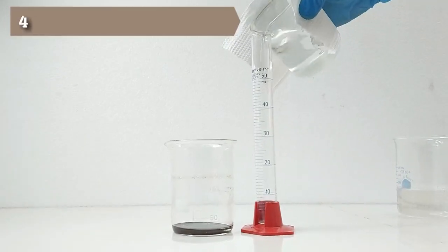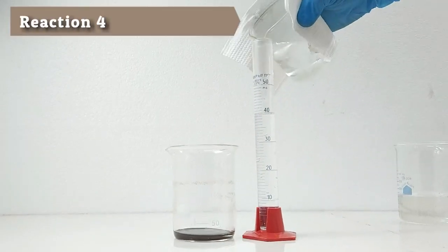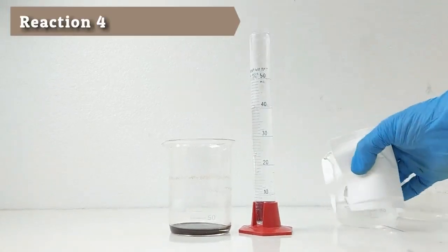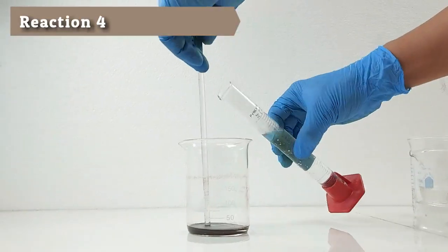To the precipitate, add about 40 ml of hot distilled water. Allow the precipitate to settle again, and then decant the supernatant liquid once more.